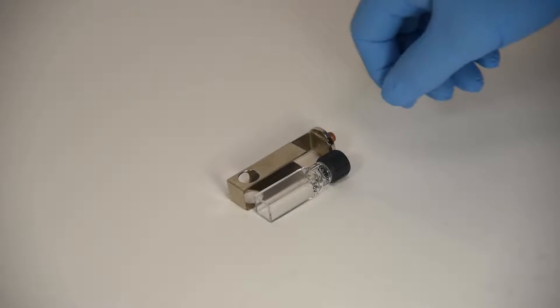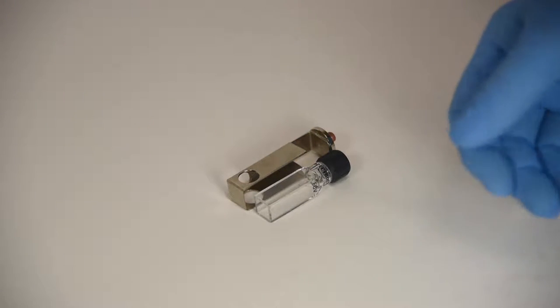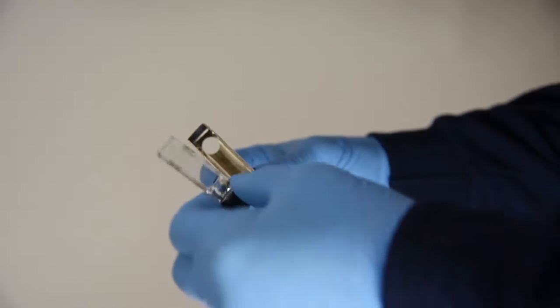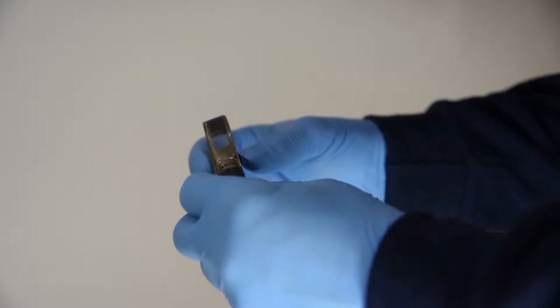But we're just looking at how to install it to the cryostat and how to seal it. You see how it slides into this, so it's kind of a loose fit.